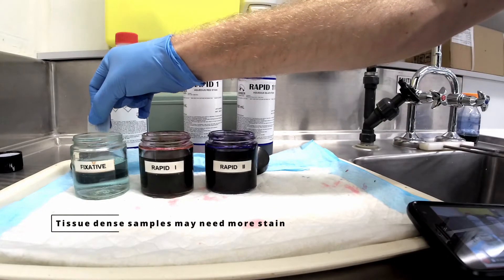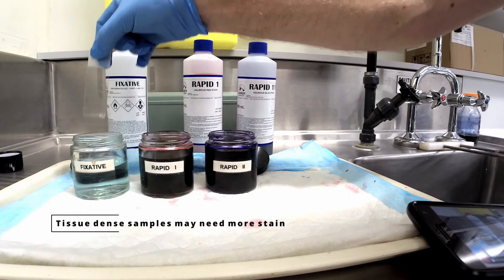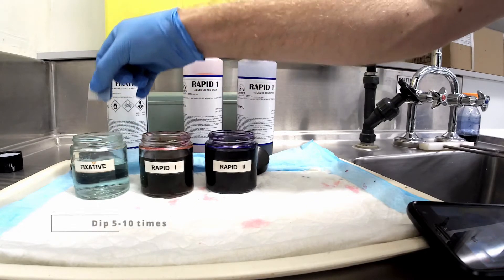Dip the slide in the fixative five times, counting 1000, 2000, 3000 and so on up to five.